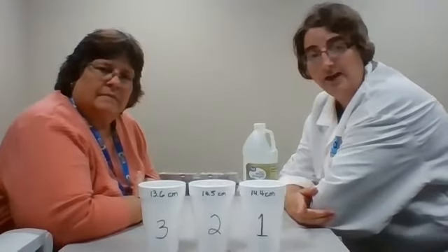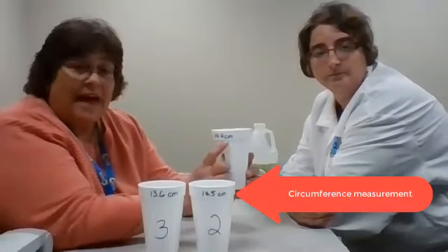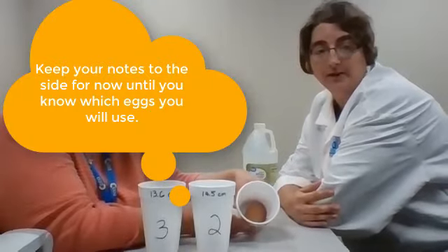So if you're just starting today, that means that you want to do part 2 of this lab 2 days from now. What we have here are 3 separate cups. We've measured the circumference of each egg, and you'll notice that we wrote it on the cup. You can write it on a cup, you can put it on a piece of paper. Just make sure that you know which measurement goes with which egg. Today, you don't want to write down the measurements on your data sheet, because one of these eggs is spare and you don't know which one you're going to end up not using. So just have the data written down somewhere else. That's why we put it in Sharpie on the cup.